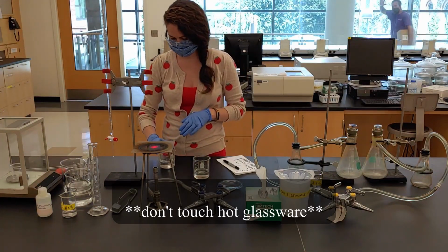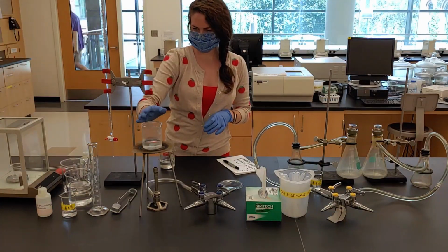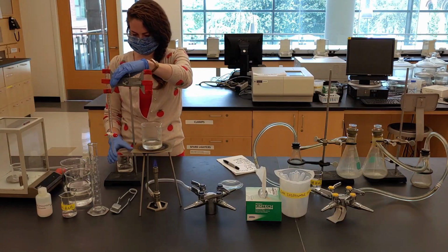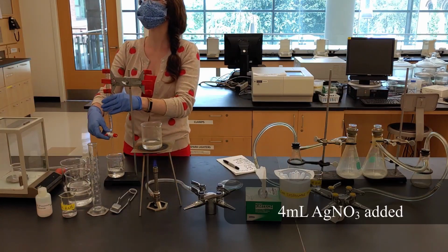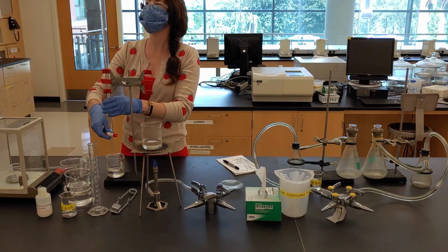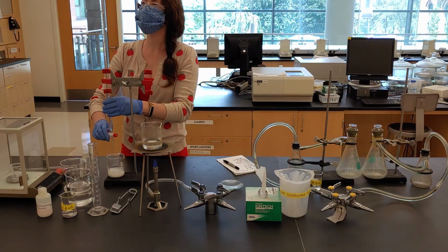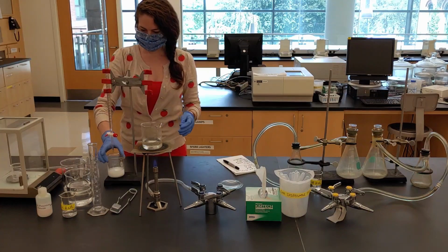Now that the first solution is boiling, it can be removed from the flame and replaced with the second. Add the first assigned volume of silver nitrate to the heated potassium chloride solution. Notice that the solution changes to an opaque white as soon as the reactants mix.